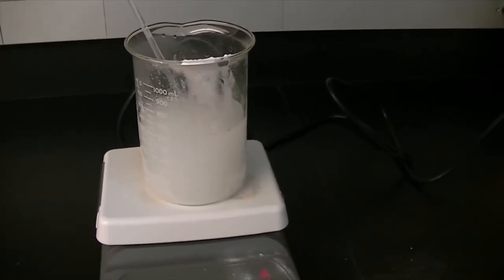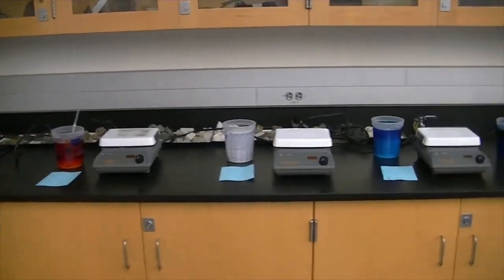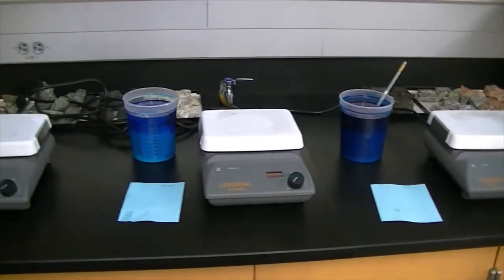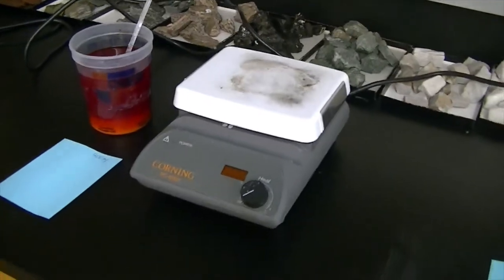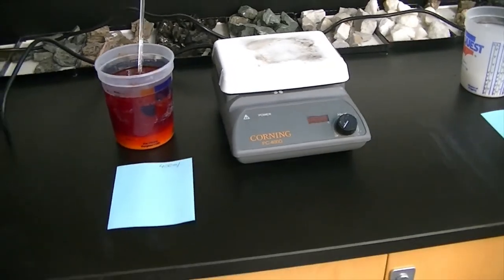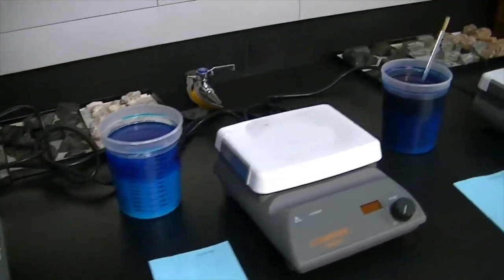Continuing now: on the five hot plates, I emptied the contents into the beakers and stirred until the material was completely dissolved. I allowed them to cool down — all temperatures were the same, turned the hot plates off at the same time, unplugged them at the same time. I removed the glass beakers and allowed them to cool significantly so they would not interfere with melting the plastic cups, then emptied the dissolved ammonium phosphate and 600 milliliters of water into the plastic cups, stirring some more.